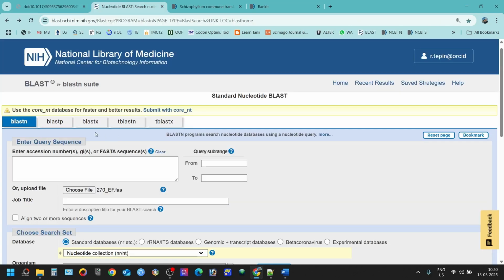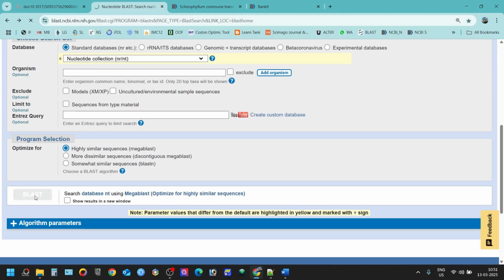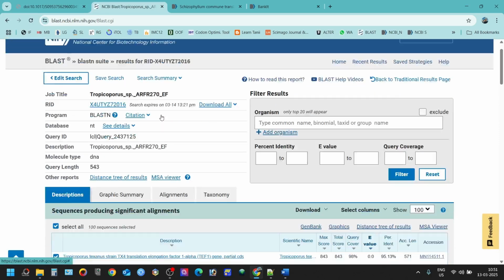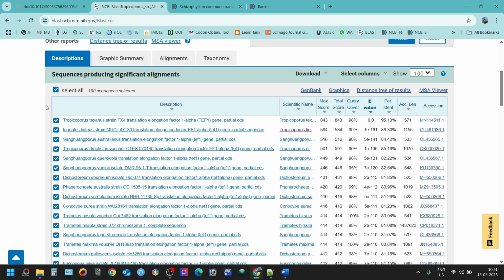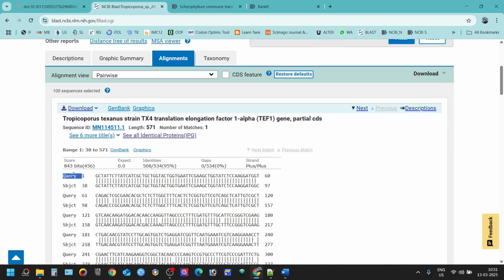So first thing first, the important thing is that you have to blast your sequence. So this is my sequence. I will blast it here. After the blast, you will find some similarities with the species. You can see here all the species that are similar to my species. So now you have to go to this alignment here. You can see this is from your sequence one. It is taken in the query, and from sequence 38 of this species it is taken. It is aligned with your sequence from the 38th sequence of this species, and from one sequence of your sequence. You can see this graphic summary here.